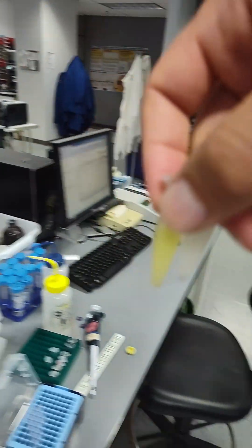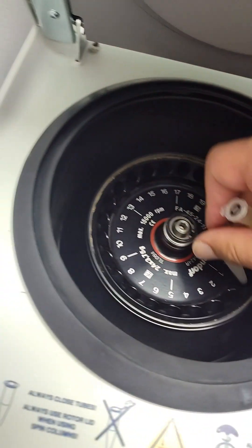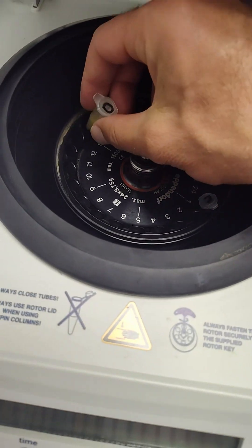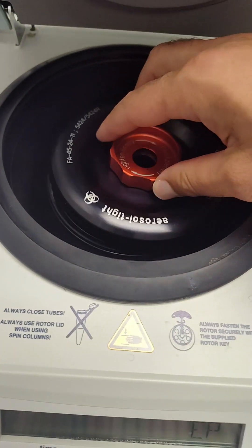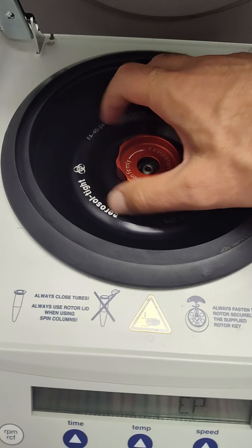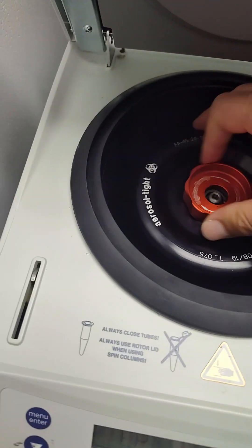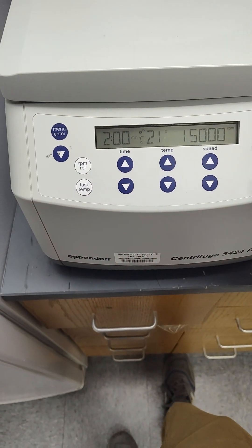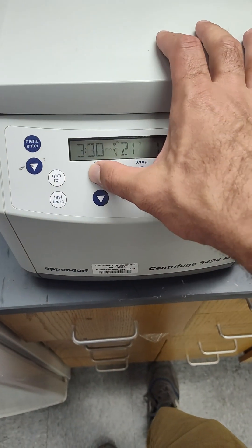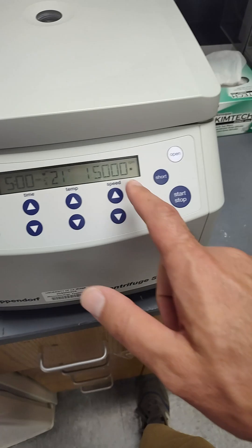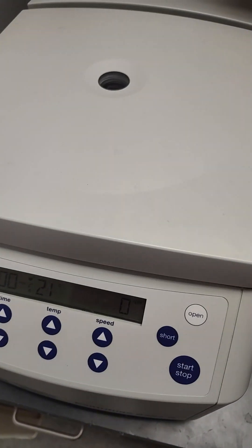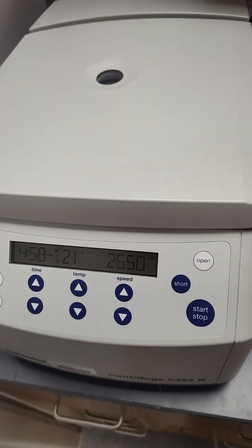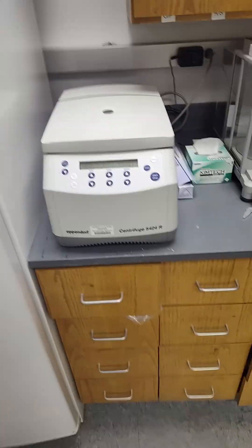Looking good. On to the centrifuge. I'm going to go up to five minutes like it says. And I'm going to do it at 15,000 just because I'm an overachiever.